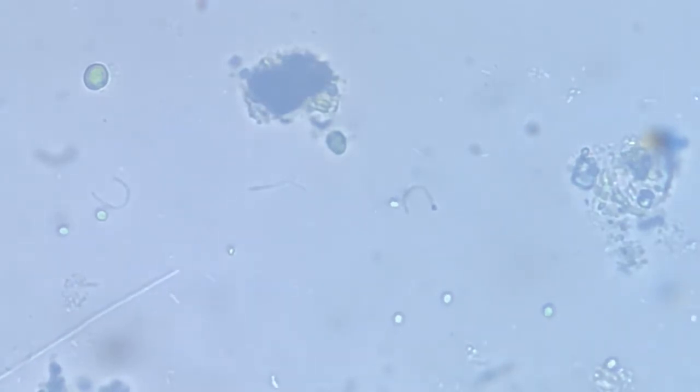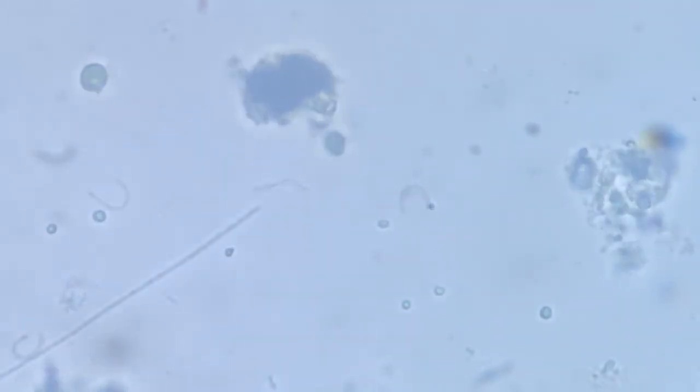And this is much, much thinner than any very... Okay, see that? I've seen quite a few of them now, and they were found in a water sample that was collected from a cow's shed.